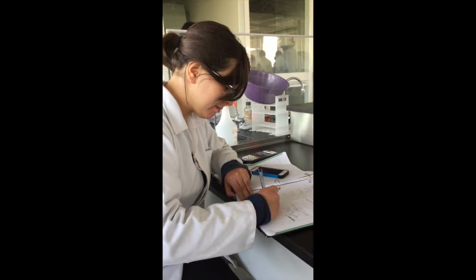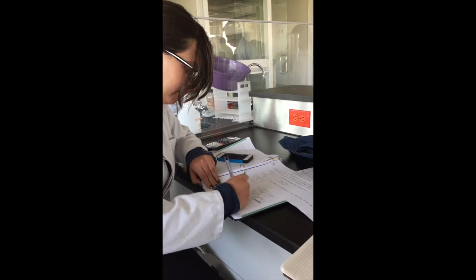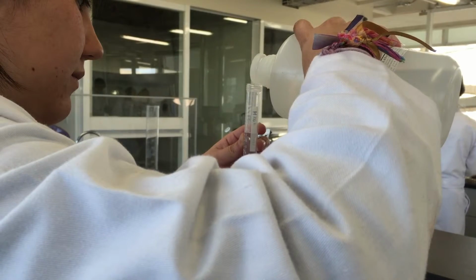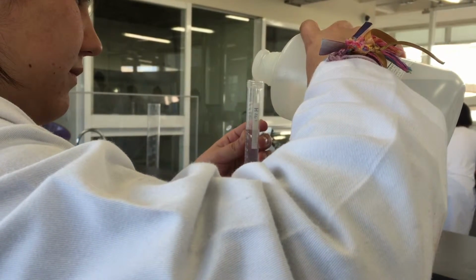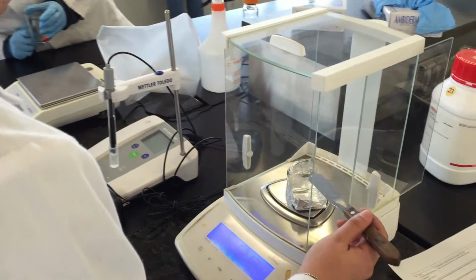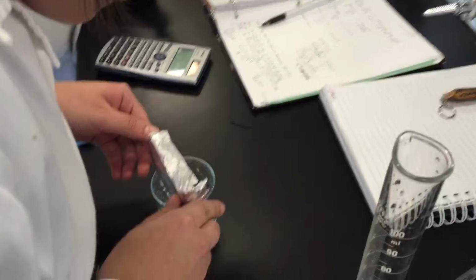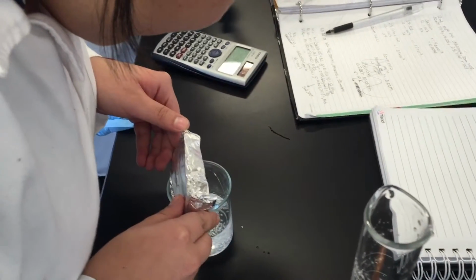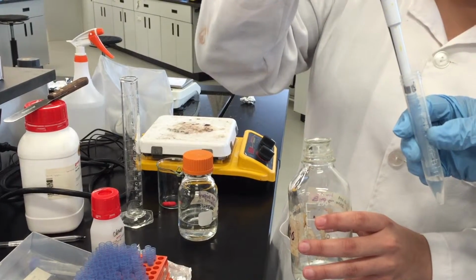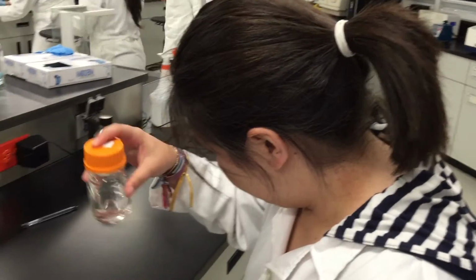For the solution preparations, the first thing you have to do is to make the correct calculations with the concentrations of the substances available in the laboratory. After this, you have to measure the exact amount of the solutions using the correct equipment and material. For mixing the substances, you have to take care of which substance is mixed first to avoid precipitation and reactions in the solution. Also, you have to take care how you are going to mix the solutions. You can use a magnet or just do it by yourself.